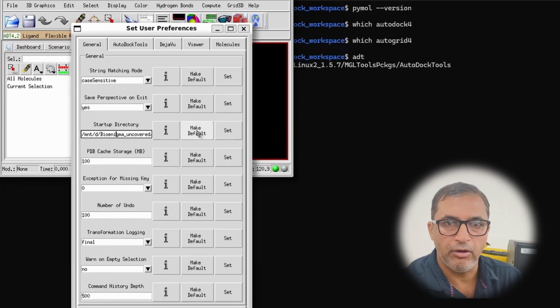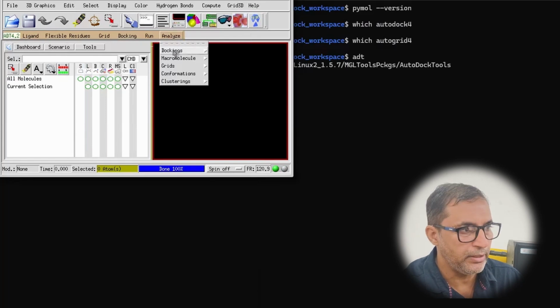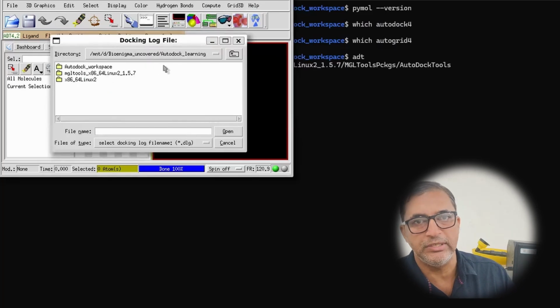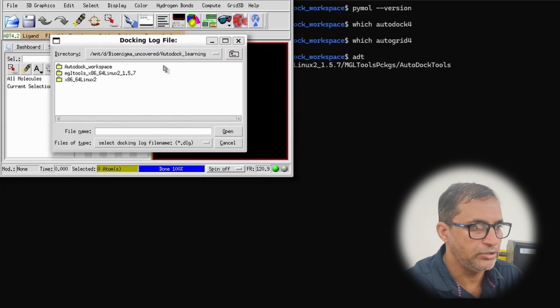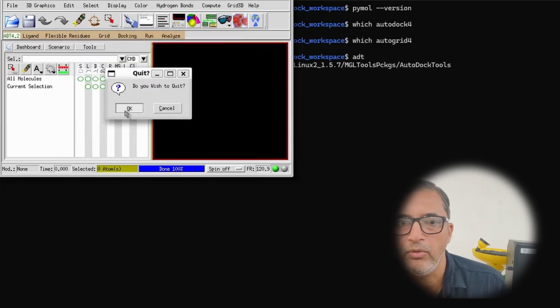Once you have done this, click on the cross option or close this window, and finally move to the Analyze option given here, and another drop down menu will open. Click on the Docking option. Another drop down menu will open here. Click on the Open option given right at the top, and you will see a new window opens. If all this process goes on smoothly, it means your AutoDock installation has been thoroughly successful. We can now close this. Another prompt will appear here: Do you wish to quit? I'll just click on Quit, and I can now close this option.